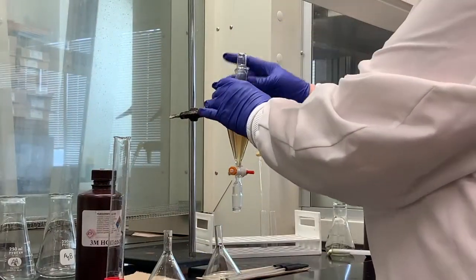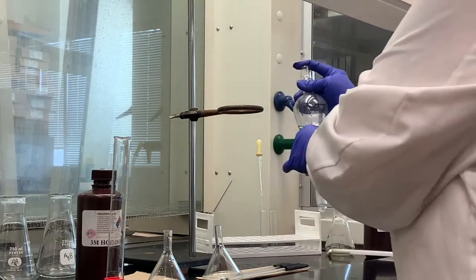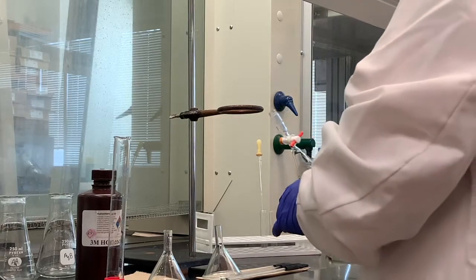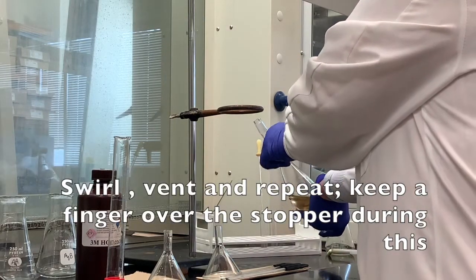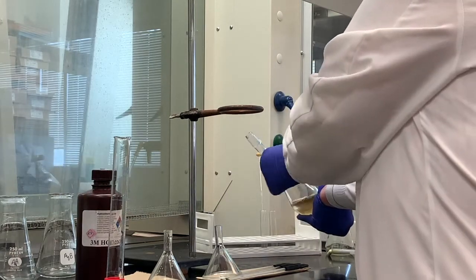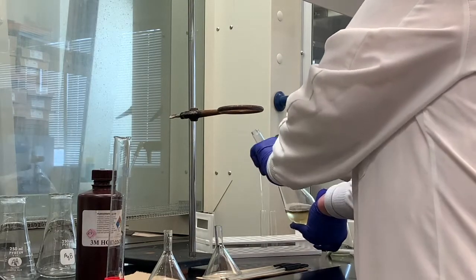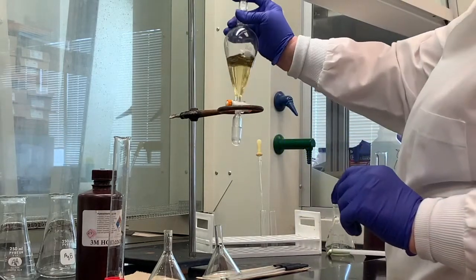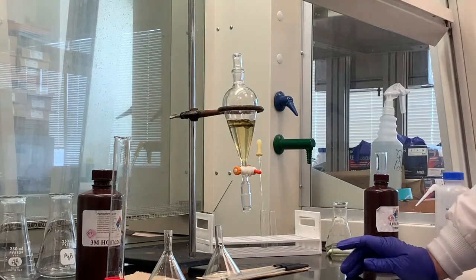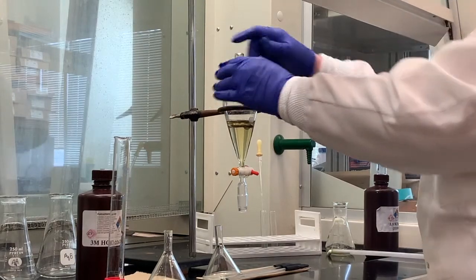Let's give it a rotation, and make sure that when you do the venting, you have your finger over the stopper. You want to give it a little bit of a swirl, and then vent, vent, vent. Usually 3 times is pretty good. Now what we're going to do is let this sit for a second.